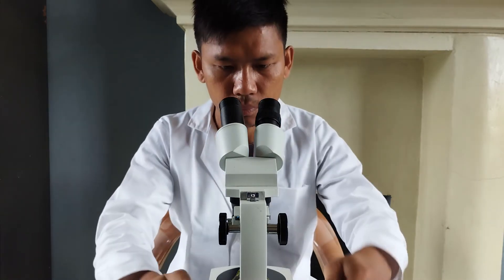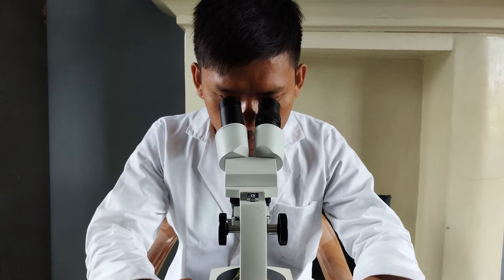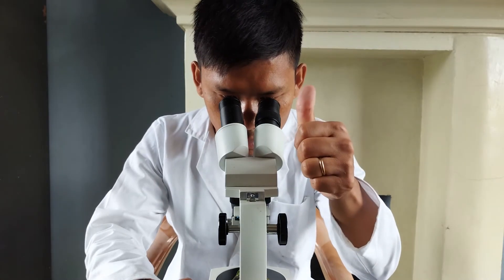Now open both eyes and look through the binocular eyepieces one more time. If you see that the object in the view is evenly focused without causing any unequal focusing strain in either of the two eyes, then the eyepieces have been focus aligned.